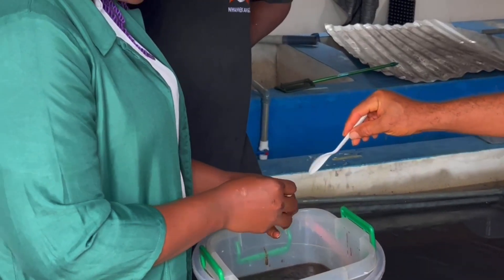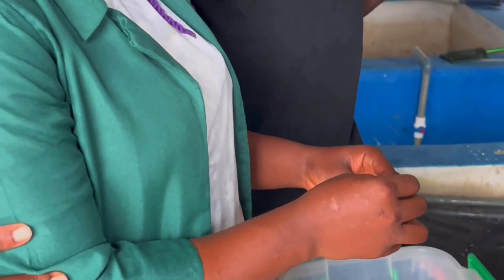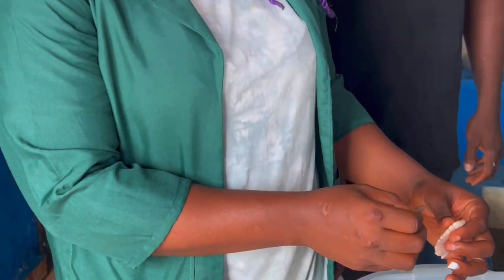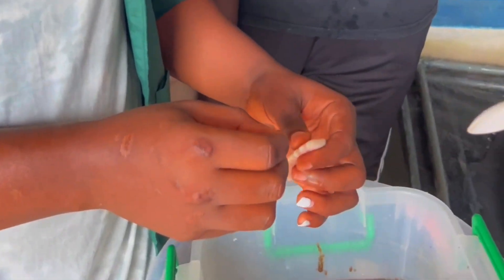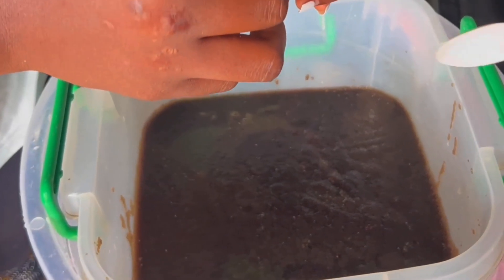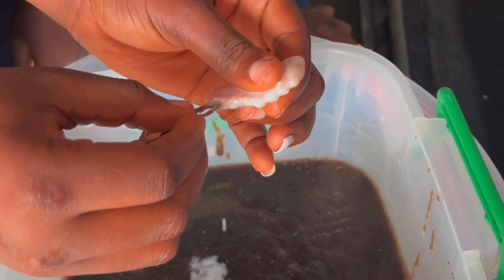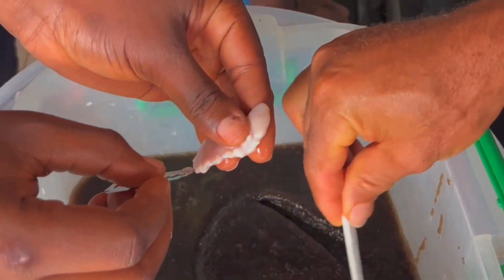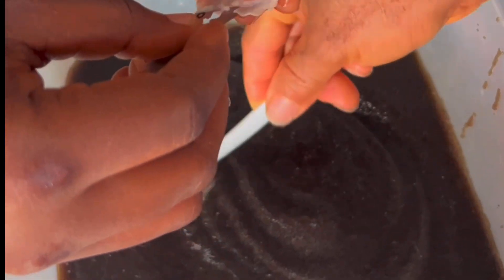Go to the middle of it, and see it — but don't cut your hand. Just let the milt drop inside. Have you done this before? You've been watching it and you're doing it for the first time. Okay, so this is how fish is artificially fertilized.